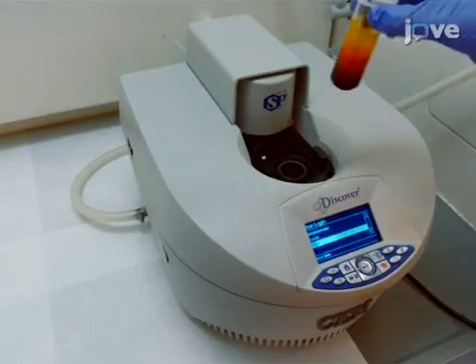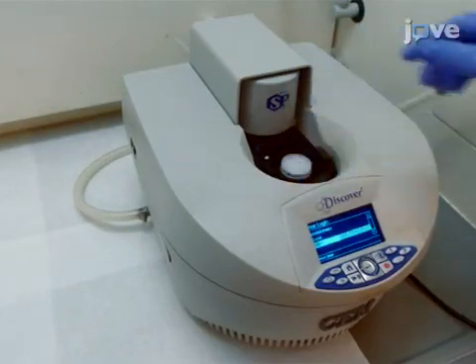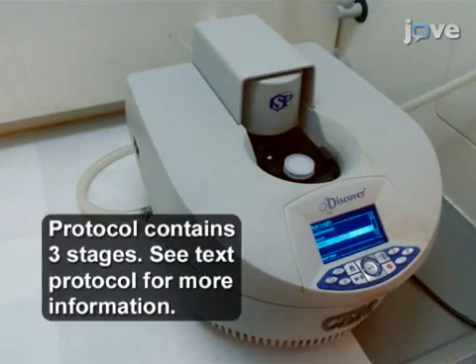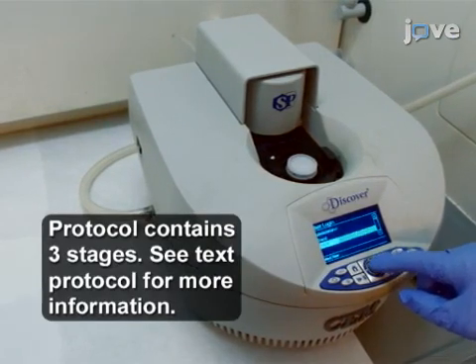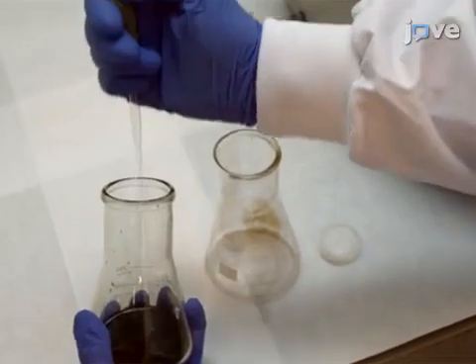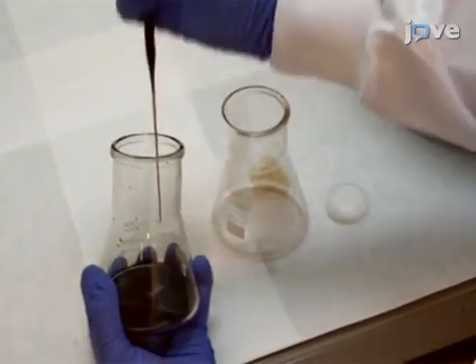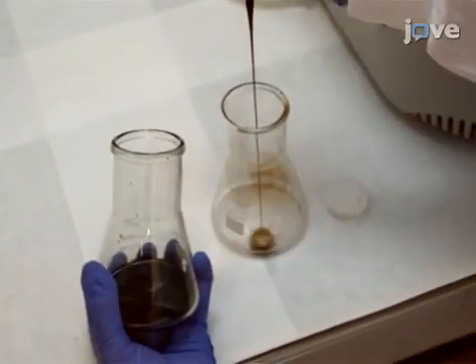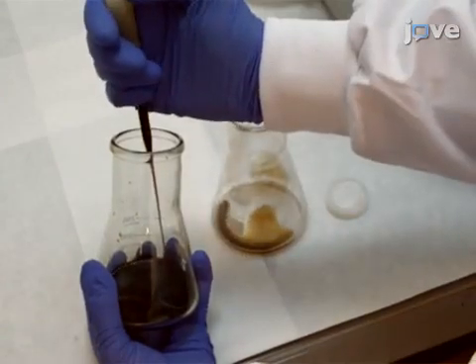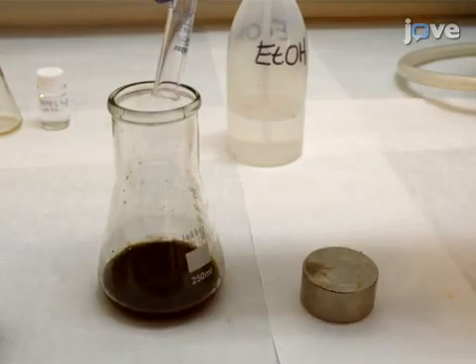Following this, place the flask in a microwave reactor and start the microwave protocol by loading a dynamic study in the microwave. After the reaction is complete and the flask has cooled to room temperature, transfer the reaction mixture to an Erlenmeyer flask using a glass pipette and add 10 milliliters of 98% ethanol.